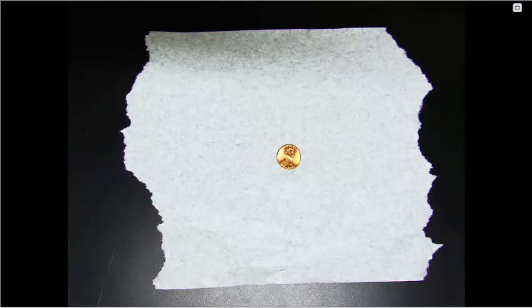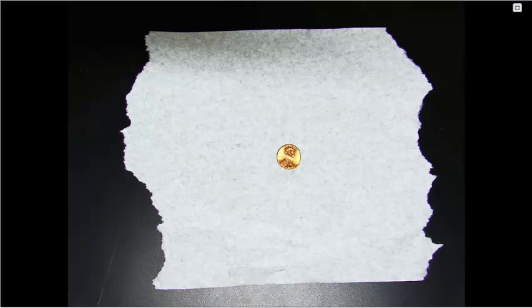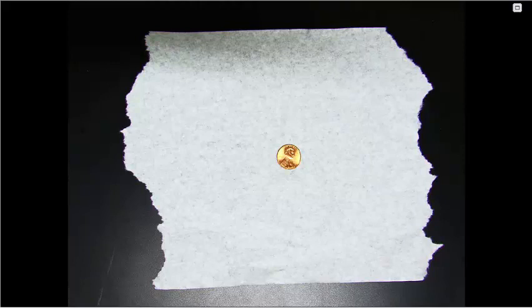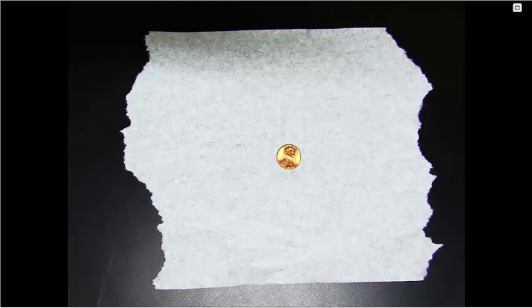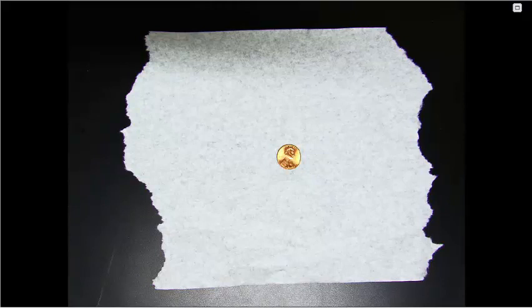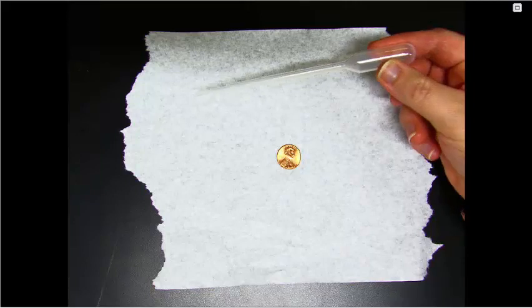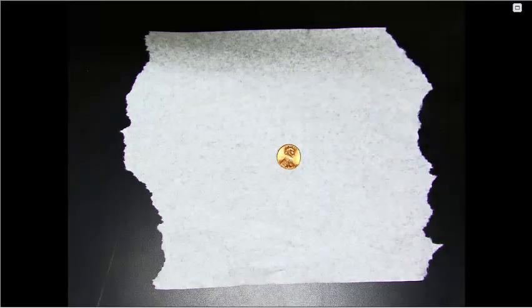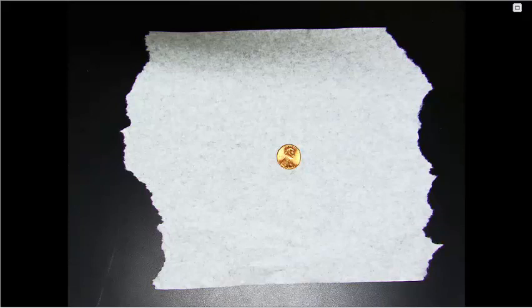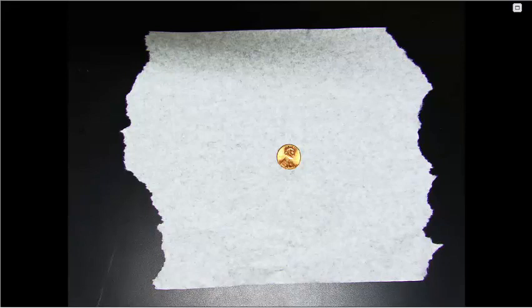You are going to want to use the same penny and the same orientation for all of your trials. We're going to start with trial 1 with tap water. You'll need a beaker full of tap water or a cup with tap water and a dropper. I will fill the dropper with tap water and now we will count how many drops of water fit on this penny surface.